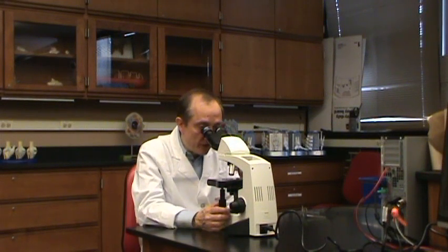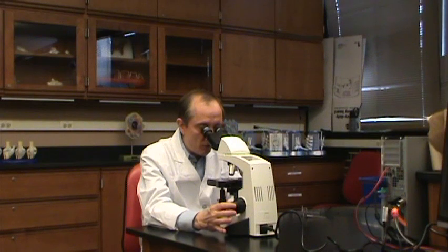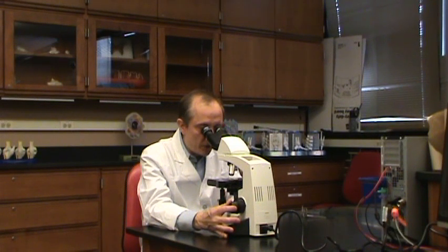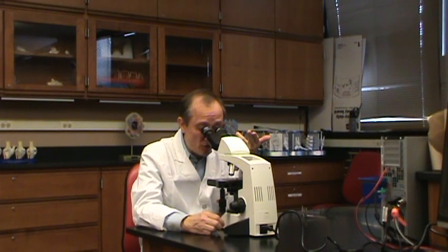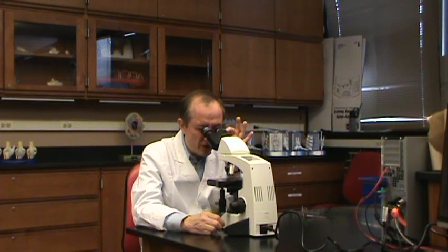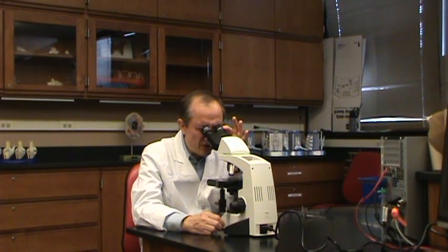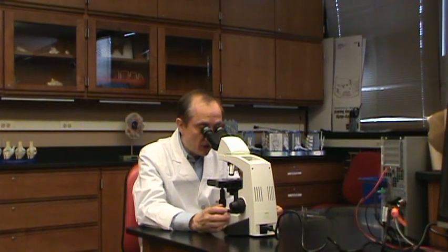Another feature on these microscopes is that you can adjust the oculars for both eyes individually — useful if one eye is stronger than the other. To do that, close your left eye and focus using only the right ocular with the fine adjustment until you get a really good image. Then close your right eye, look with the left eye, and turn the adjustment on the left ocular lens to bring that into focus. Now open both eyes and you should have a clear, sharp image with no strain.